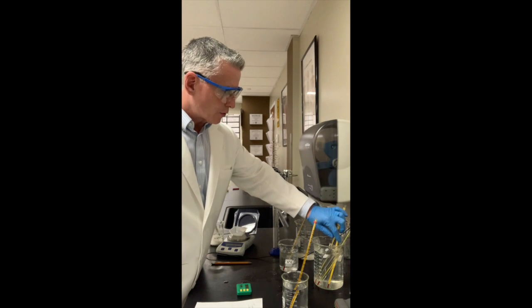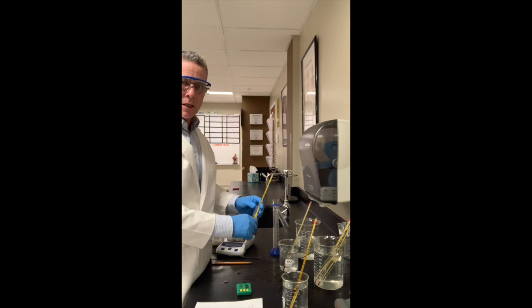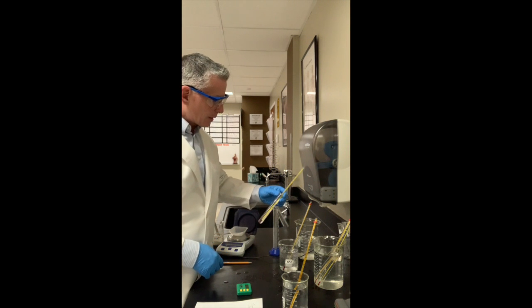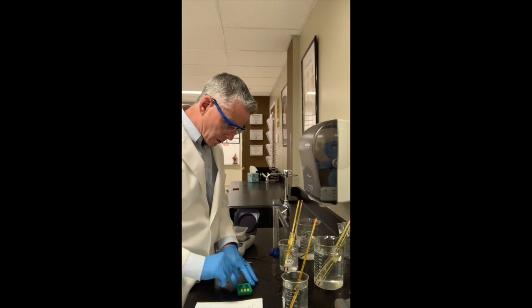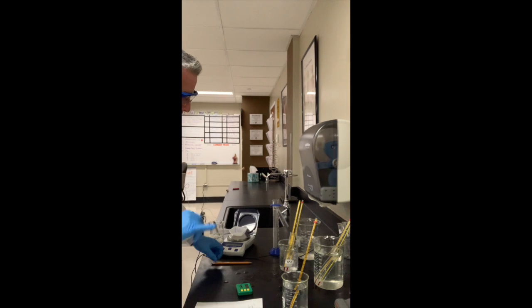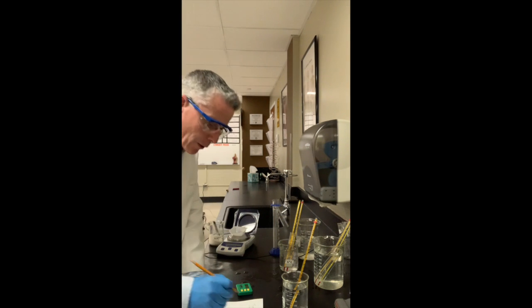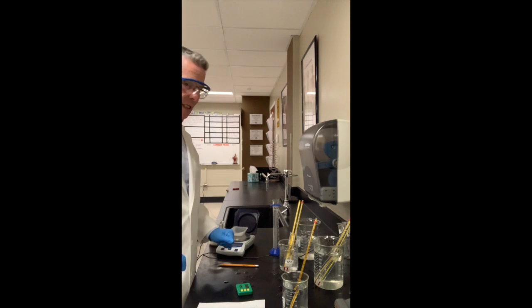Okay, so I am going to take out one test tube representing the body of Ana Garcia. The starting temperature is 37.5 degrees. I'm going to hit start right now. The original temperature is 37.5. The original temperature of the water bath, however, is 3 degrees Celsius. I couldn't get it any lower.